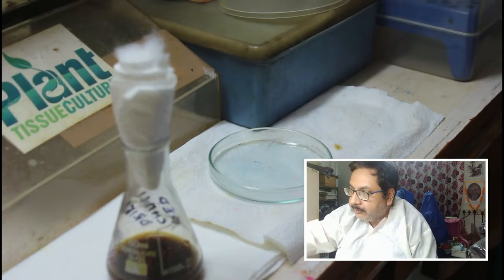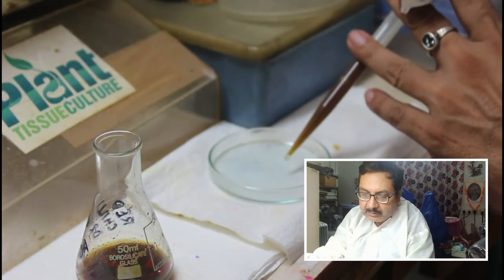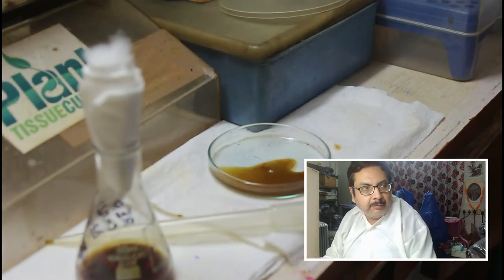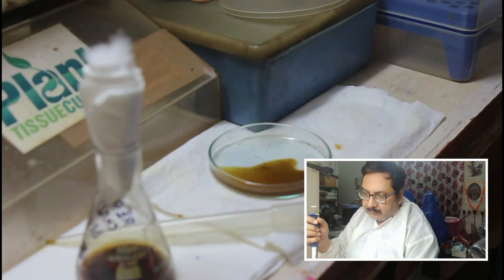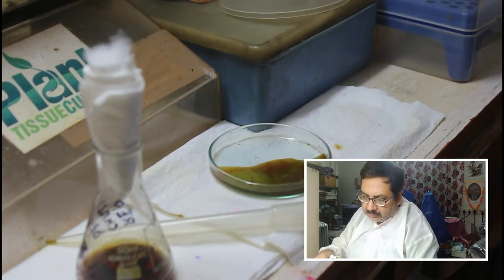Let us begin the experiment. We will take a first investigation today. With the help of a pipette, we will take around 3 ml of the media. As always, it has become brown and very congested, so we need to mix 1 ml of sodium glycinate buffer — here is our sodium glycinate buffer — just around 1 ml. We will mix it, and it is done. We will now examine this under the microscope.